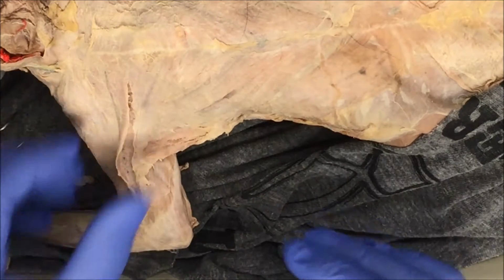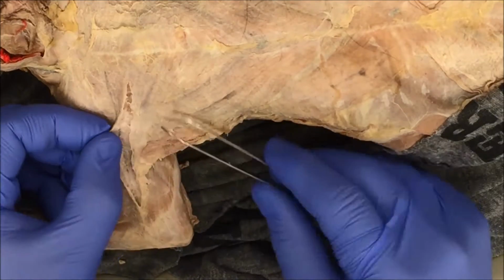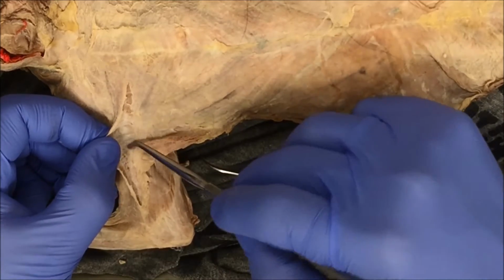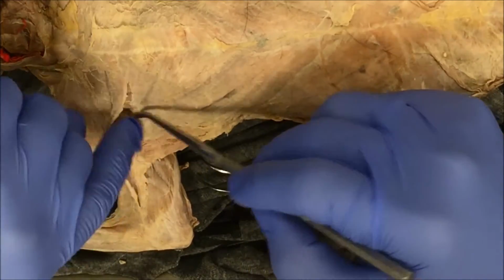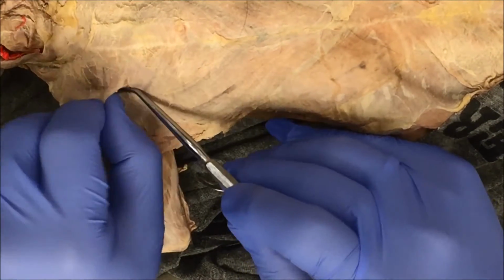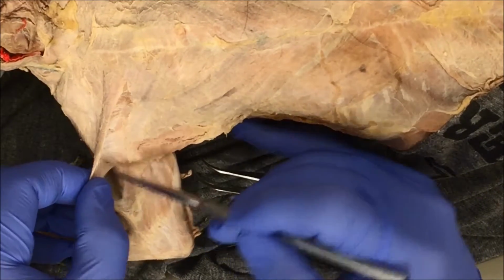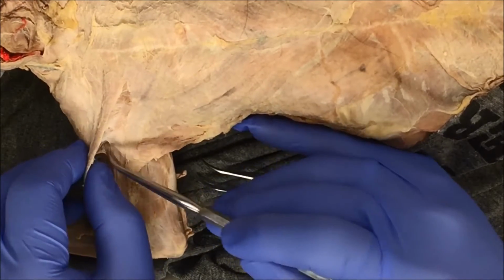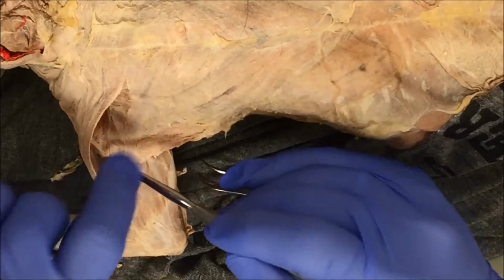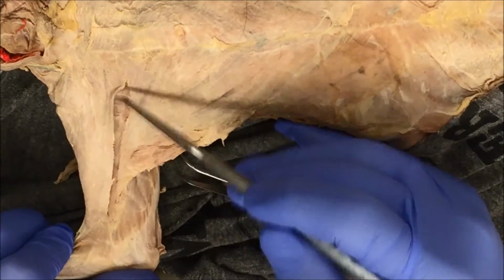Okay, so you can see when I fold this muscle over, there's still connective tissue holding onto this muscle. You can use your blunt probe to push down and pull up, like we've done with previous dissections. You can see just how flat this muscle is here. I've only dissected one side. I haven't dissected the other side yet. I'll do that here in a second. All I'm doing right now is push, pull, push, pull, just to separate this side. So you can see in here, I've already separated this one side of this muscle.